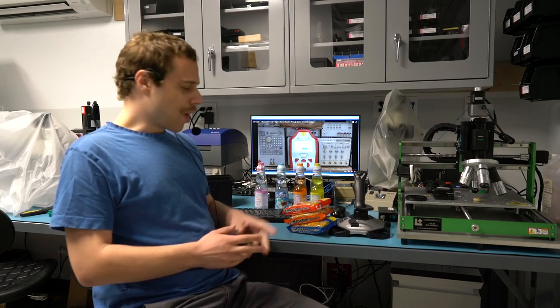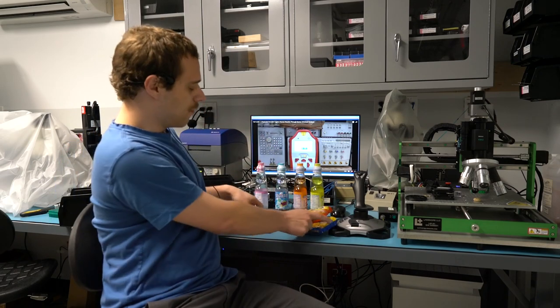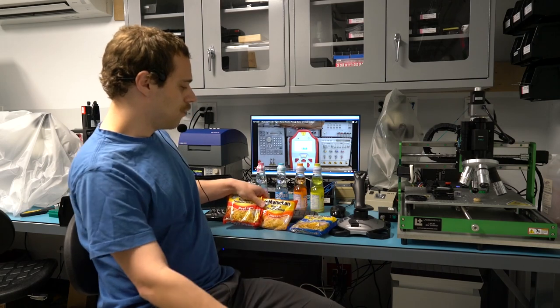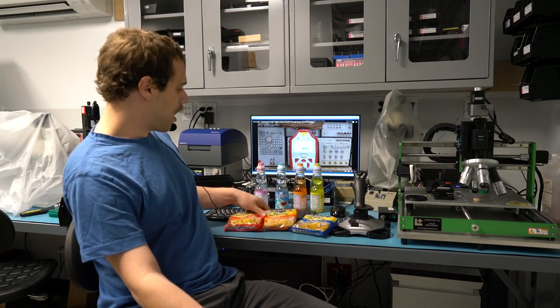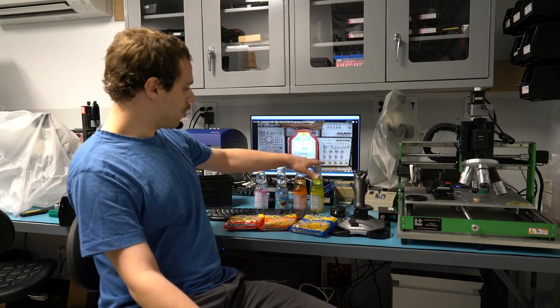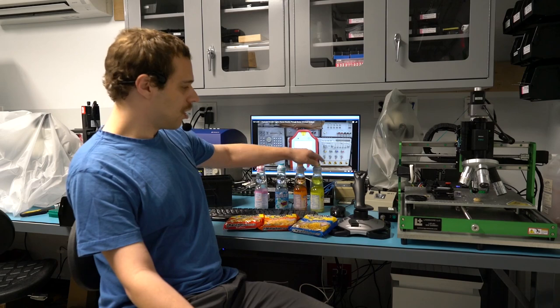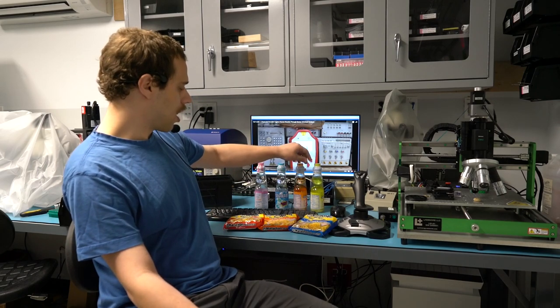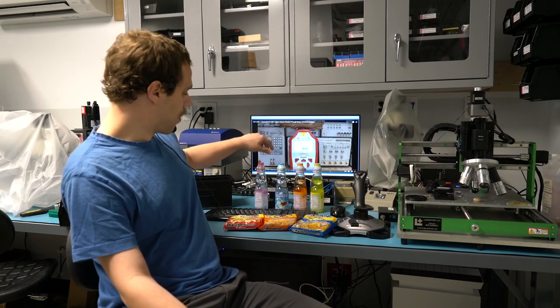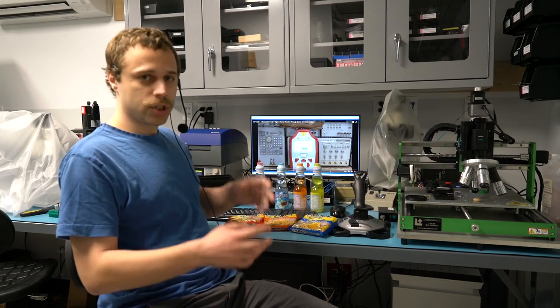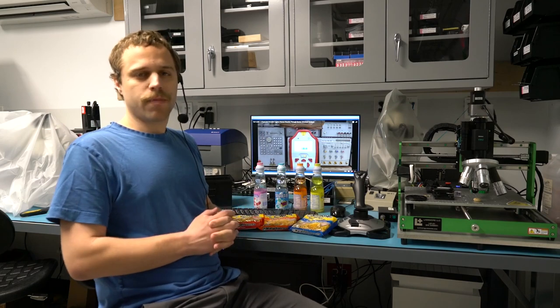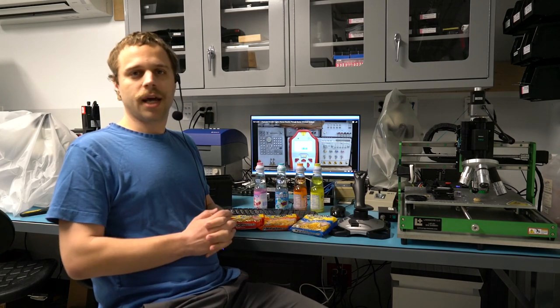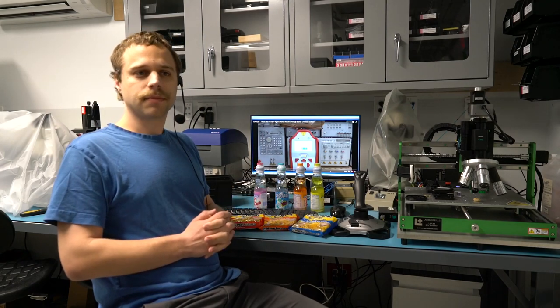You can see here I've got three different flavors that we can try and identify in UV, visible, and infrared. I've got four different flavors here. These two should be pretty easy because of the different colored dyes added to them. But the lychee and the original are both transparent in the visible spectrum. So let's see if we can actually tell them apart.